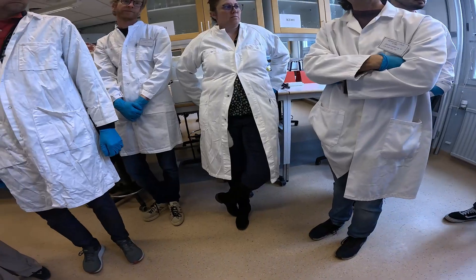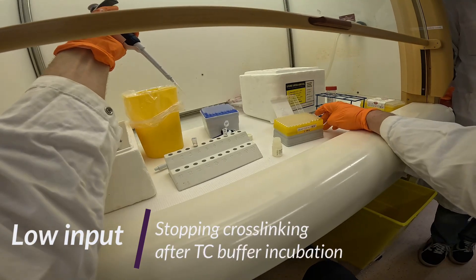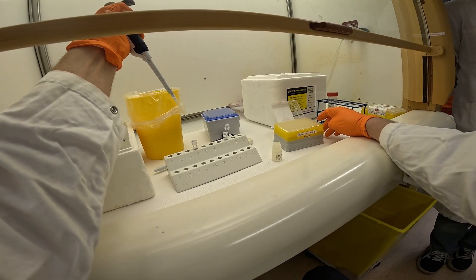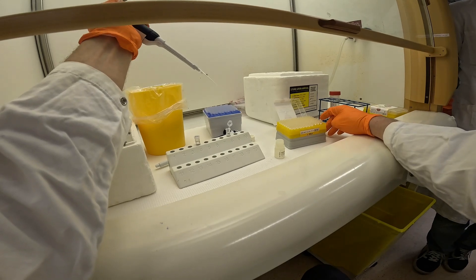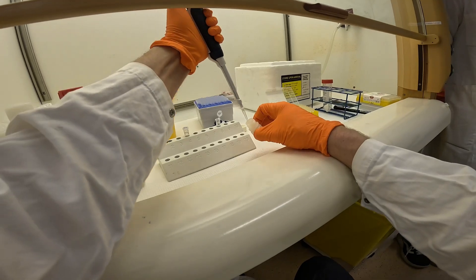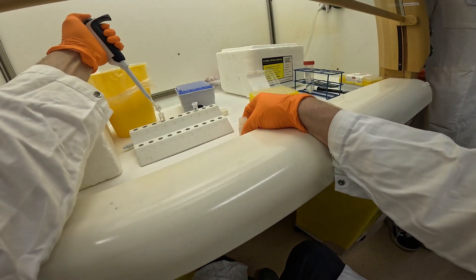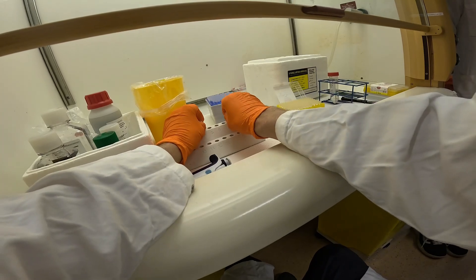All the samples go to the fume hood. This is a krill sample, so we have low input samples around 30 to 40 milligrams of tissue. We have added one ml of PBS and then 100 microliters of tissue cross-linking buffer. The incubation times for the cross-linking are the same. Now we are adding the stop solution, which is a similar low volume, and as before we do inversion mixing.